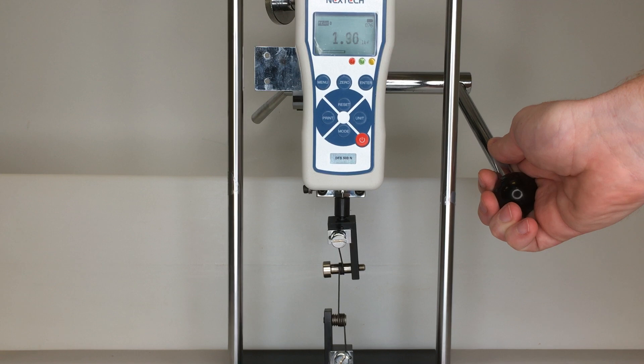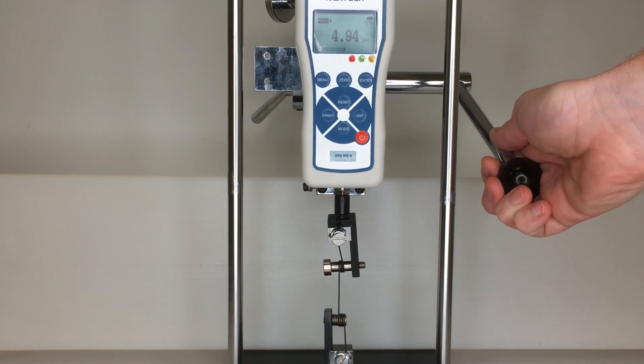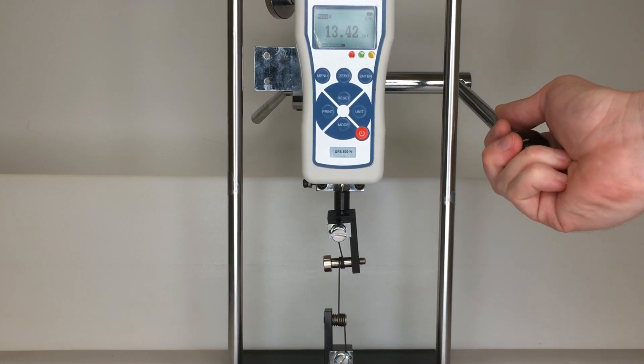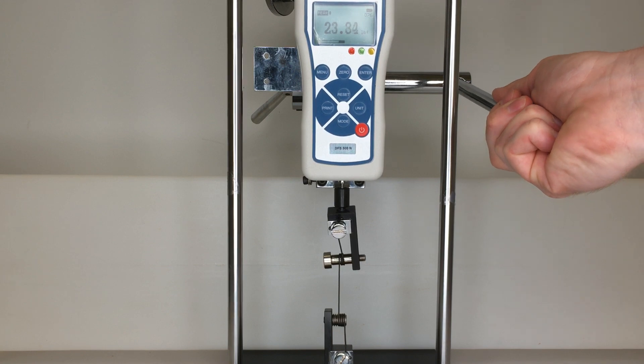You can see that initially the yarn goes under tension as I am increasing the force and we are going to continue pulling until it breaks.